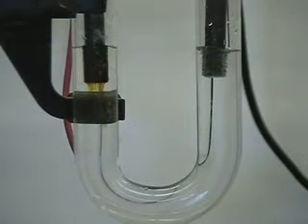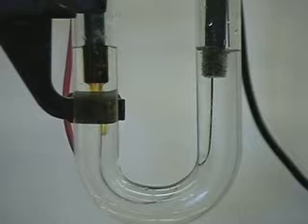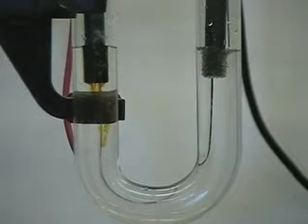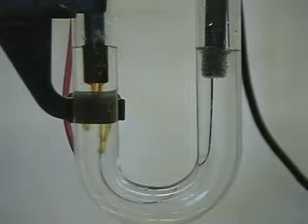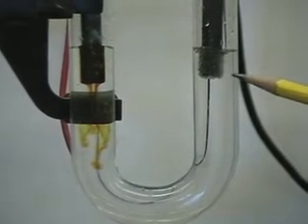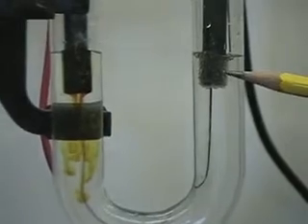We're going to add some phenolphthalein to the other side. Remember, we said that hydrogen gas is produced — let's zoom in and take a look. Sure enough, look at the bubbles. We've got hydrogen gas being produced. Now if we are also correct, the solution should go pink when I add phenolphthalein. Let's just drop it right in there. Look at that.